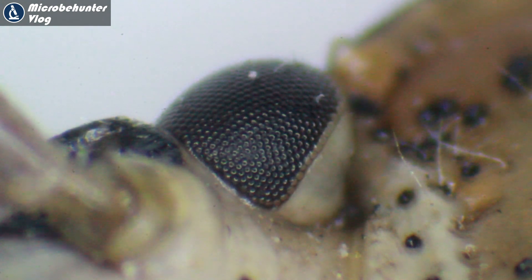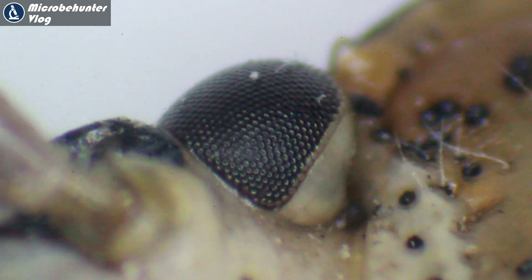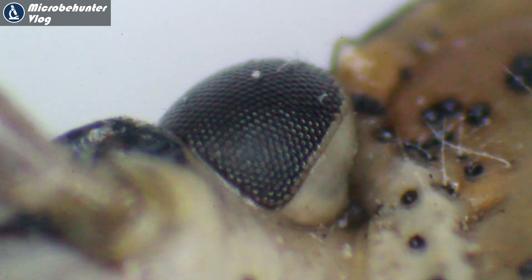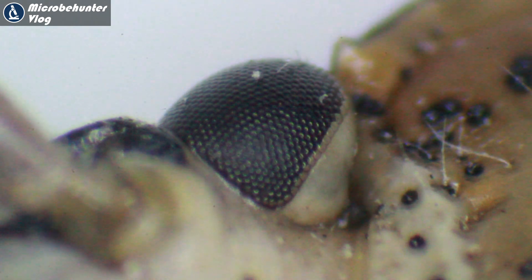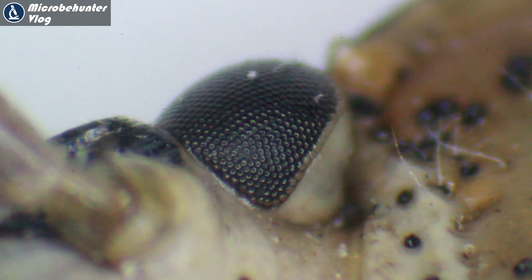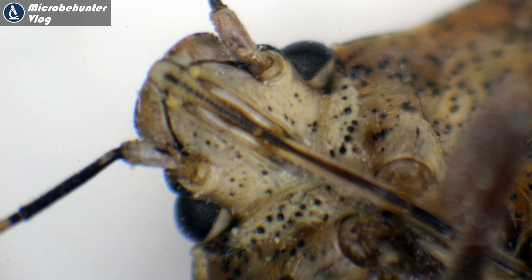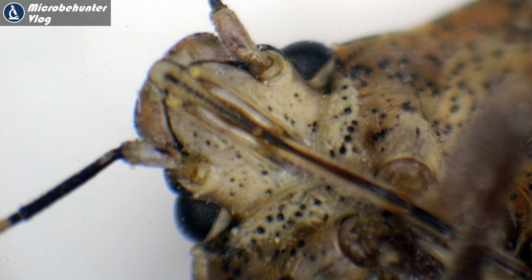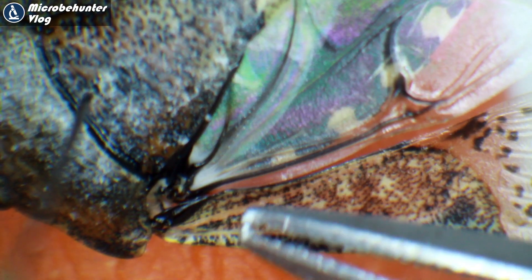Today I'm going to be looking at an insect under the microscope. Here is the compound eye of the insect in question, and specifically I'd like to figure out which type of insect it is. Later on I'll also show you how to make a permanently mounted slide of the insect's wings.